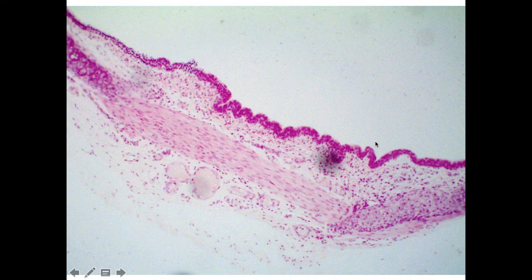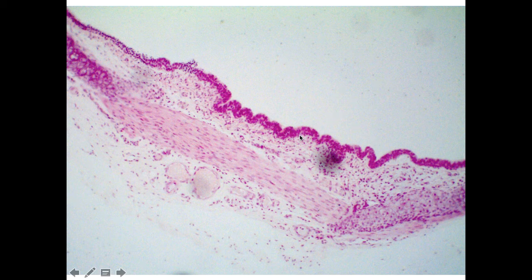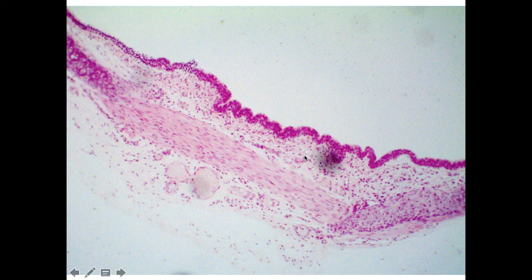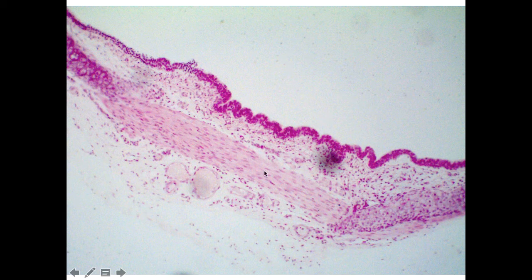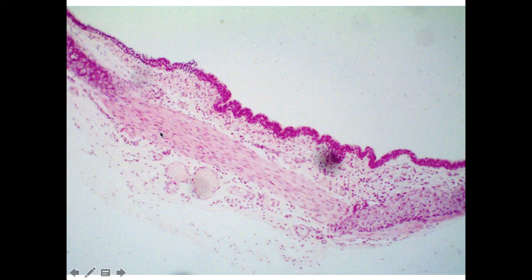This is now the posterior surface of the trachea. From this magnification, we can still see the epithelial layer of the mucosa — the pseudo-stratified layer — as well as some of the submucosa. The reason I'm showing this is because in the trachea, the hyaline cartilage rings are C-shaped. That C exists on the anterior surface but does not continue all the way around the posterior surface.